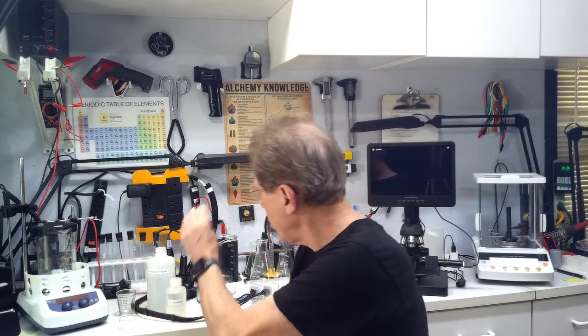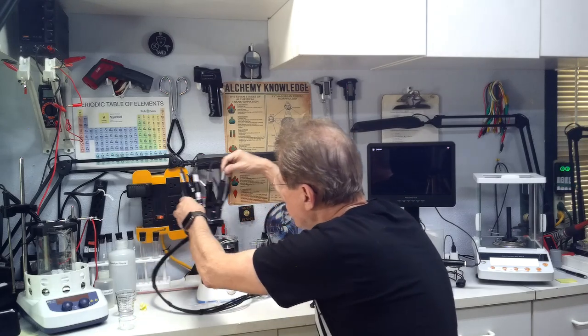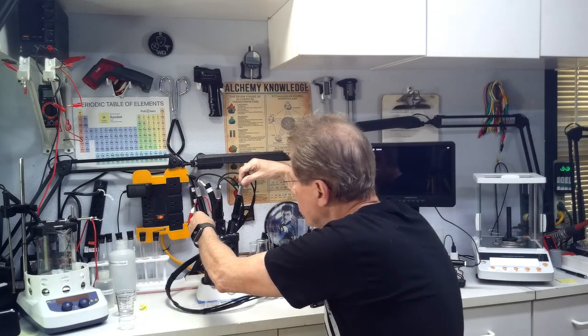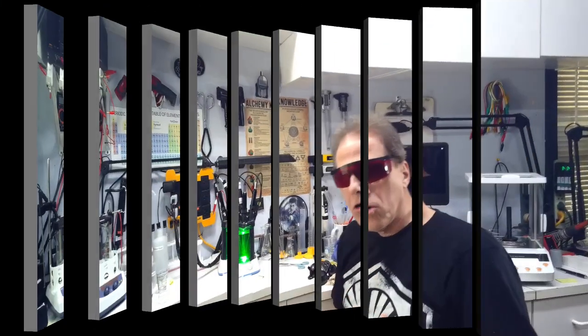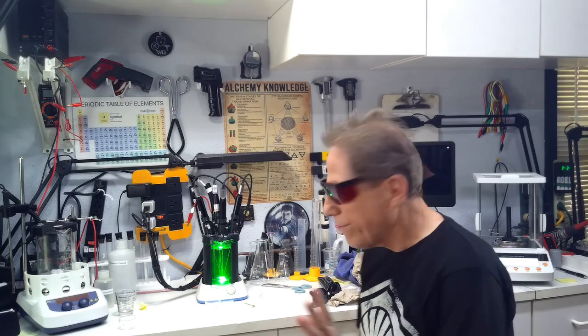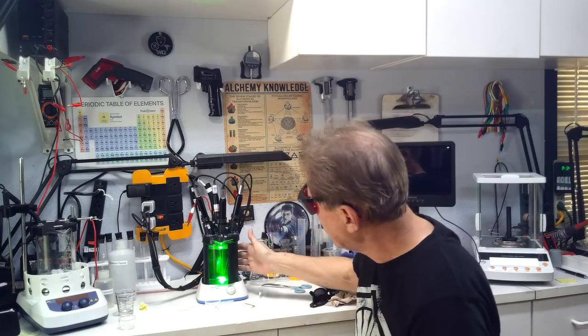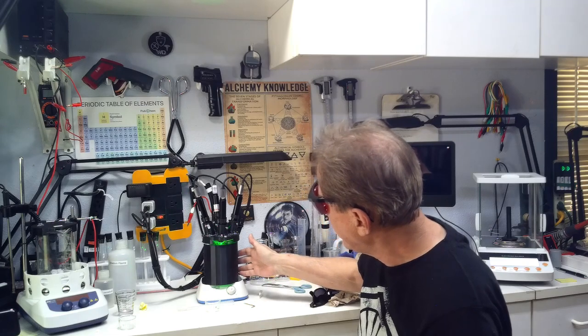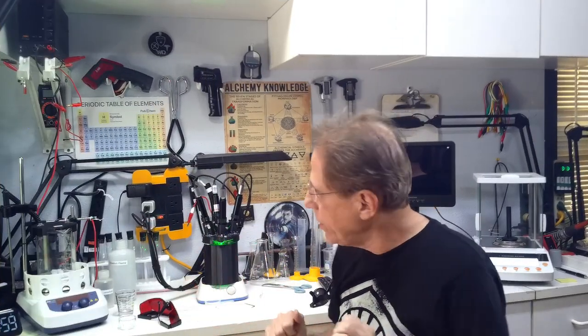The first thing we're going to start with — I've got my vanadium chip here and we need to wait while that gets going. Now I'm going to put the laser rig on top here. This is the shield, which we're going to turn. Lasers are adjusted — it took me a few moments. I don't know if you can see the laser beam shooting in here. I've got the red glasses on; I'm going to turn this around in the back so the green laser isn't flashing in my eyes. That's part one of what I'm doing here.